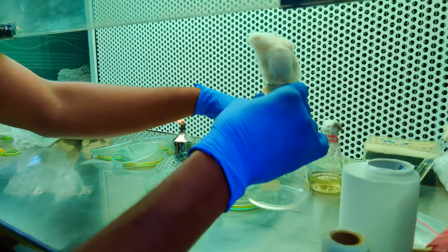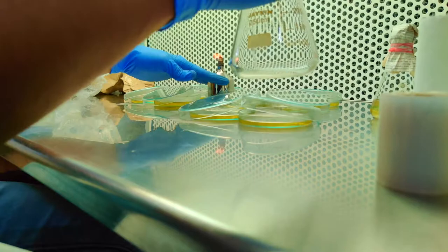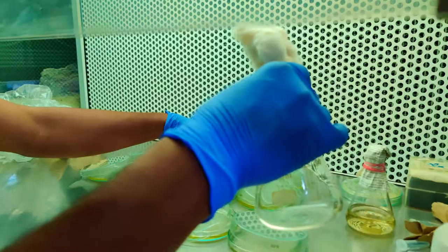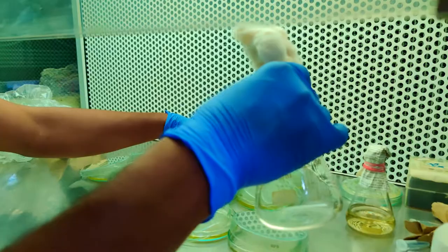Finally we came to an end. After getting dissolved, you have to mix the plates properly by rounding it, and then you can leave it by turning on the UV for some time. Thank you.